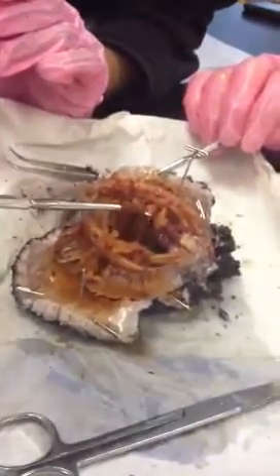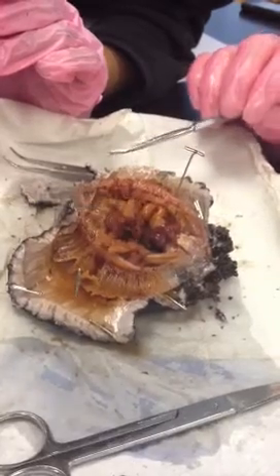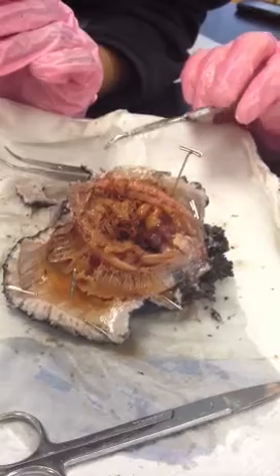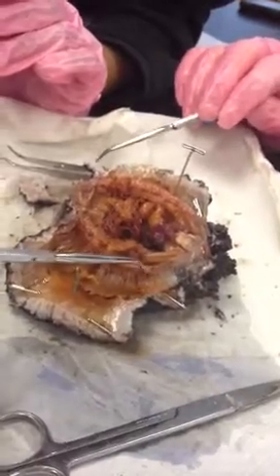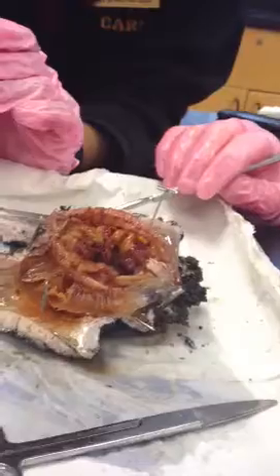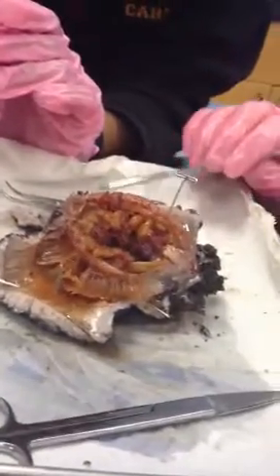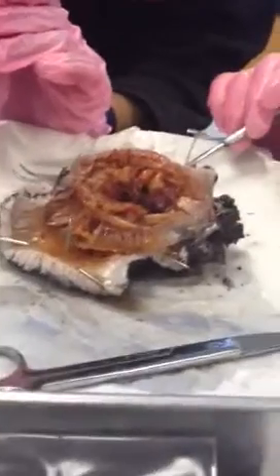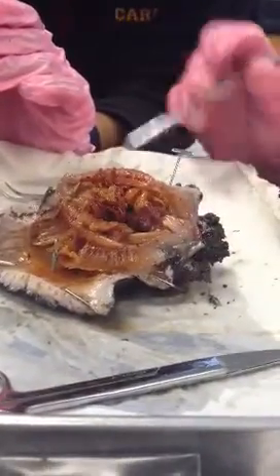What do you suppose all this red stuff is? Gonads? Exactly correct. Yes, go. And then you see how there's like little red shrapnel here? Yeah. On the outside, see how this looks all pretty? Mm-hmm. That's called the respiratory tree. Okay. It disintegrated. So that's what typically happens. So if there's a question about that, it'll be a diagram question. Okay. Not on the cucumber itself.